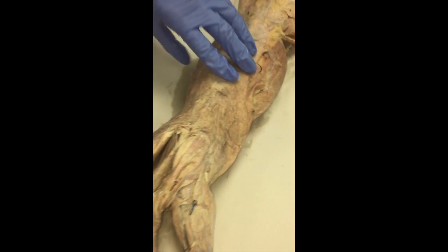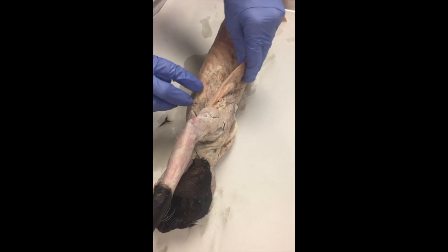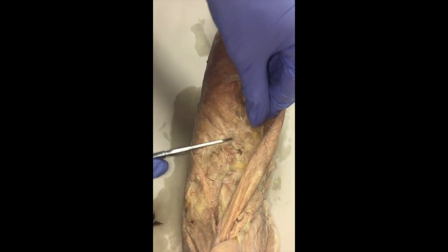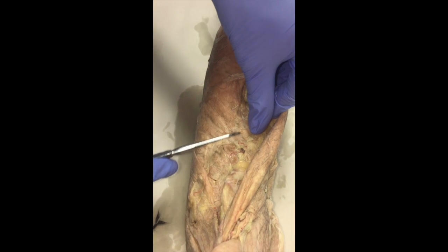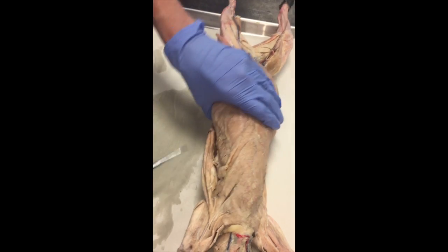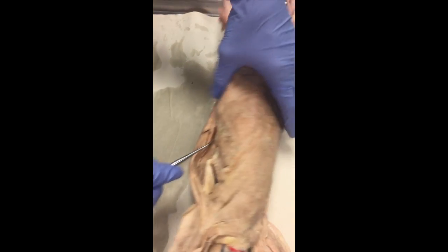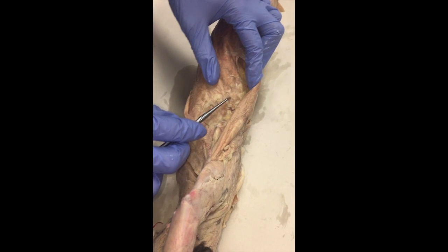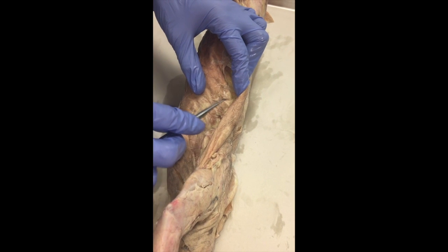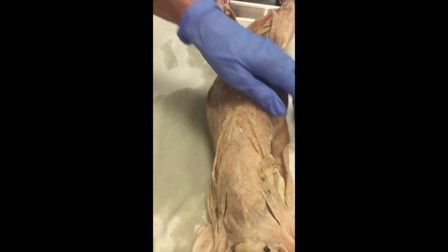Flipping it back to the front side, we need to see the external intercostals. To find them, we go behind the serratus ventralis. This is kind of a fatty cat, but you see these ribs here? They're between the ribs. Some cats show it better — there's a rib, there's a rib, there's a rib. You can hear how it's clicking. These muscles in between the ribs are the external intercostal muscles.